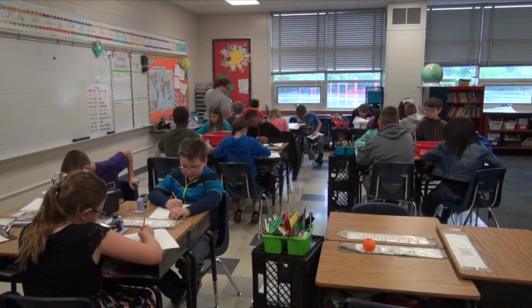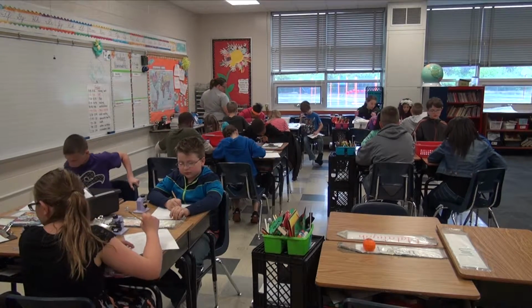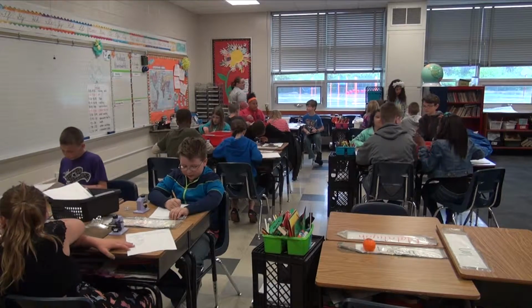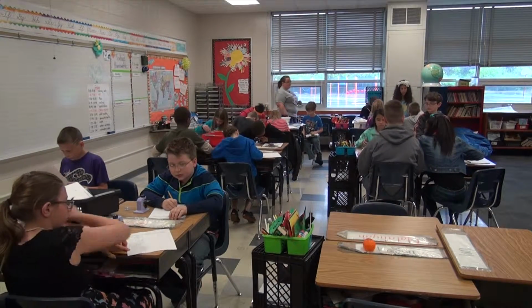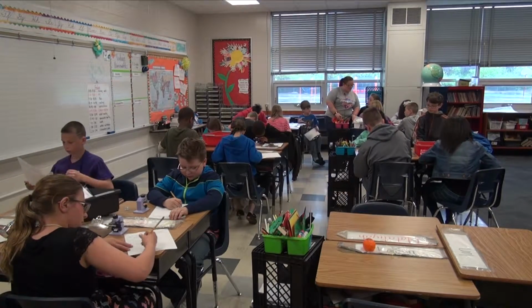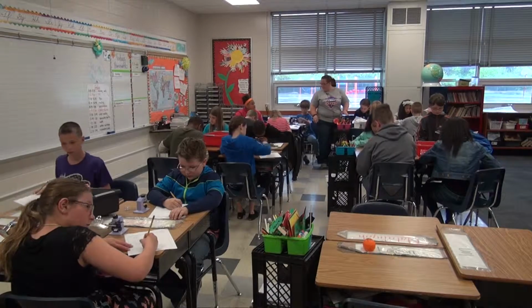Doing okay? Don't forget your name. Can you see it, Talia? Can you guys see your different substances under your microscope? I got it perfect. Yeah, good. I got it perfect. Isn't it neat?